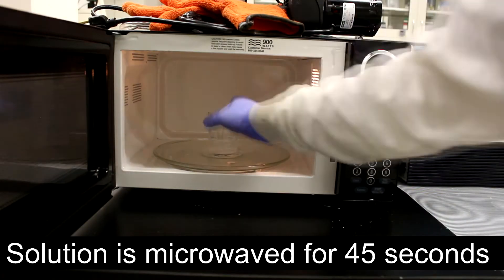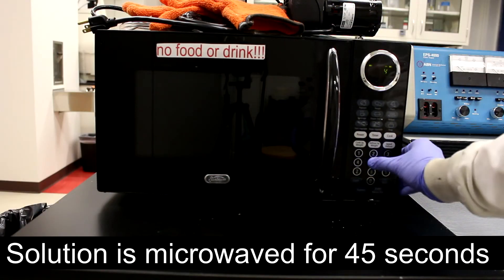The beaker gets microwaved for 45 seconds or up to 60 seconds if the agarose hasn't completely dissolved.